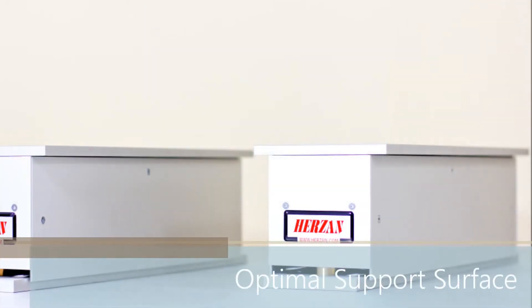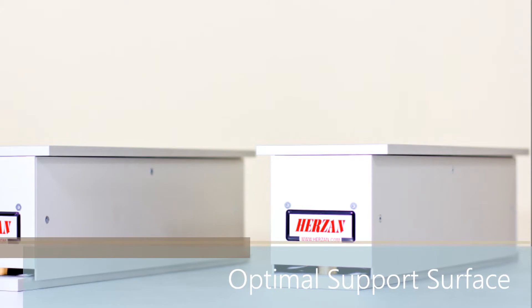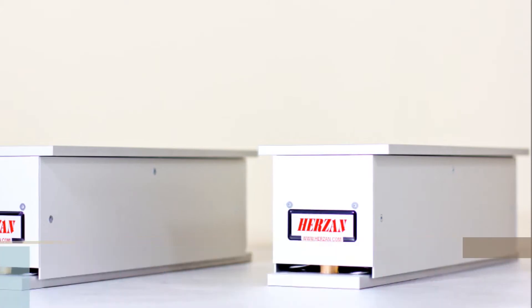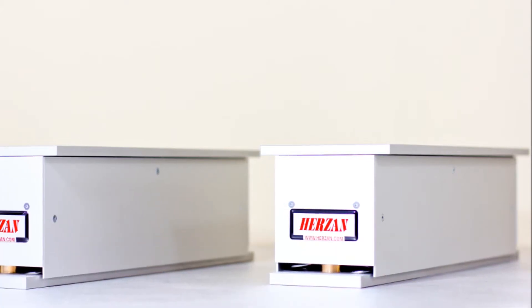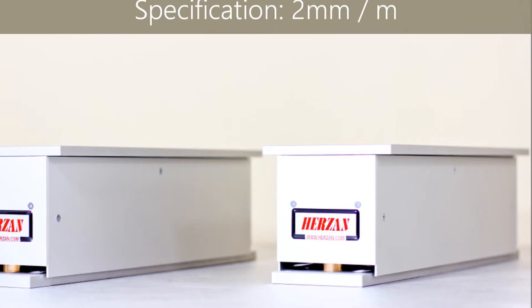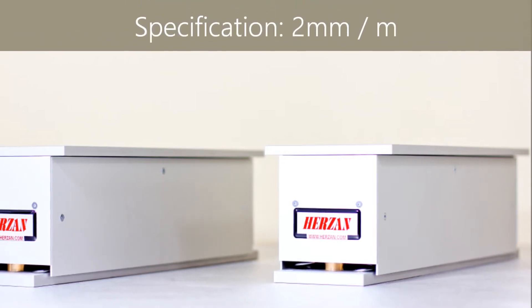Please note, the surface area in which the AVI modules and instrument are placed must be rigid and flat, adhering to the AVI series floor flatness specification for optimal active vibration isolation.